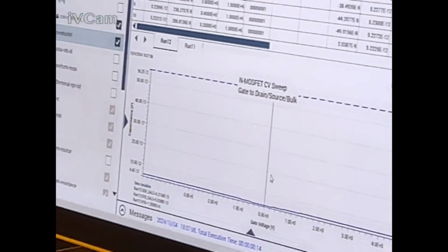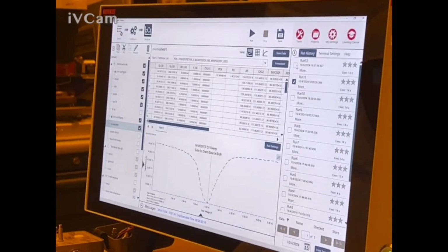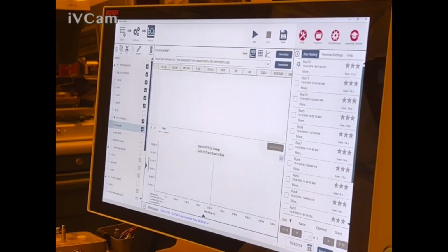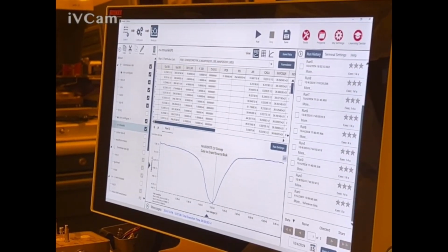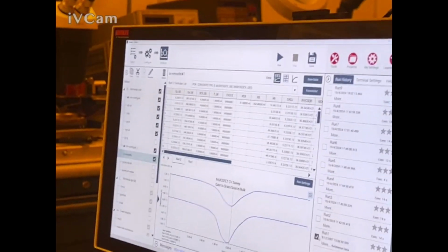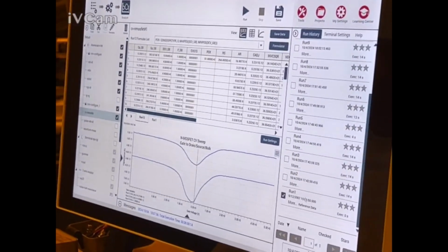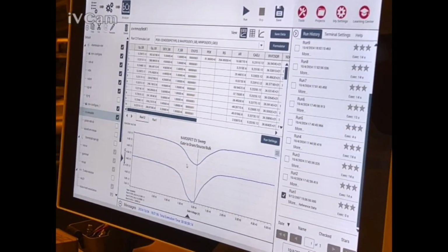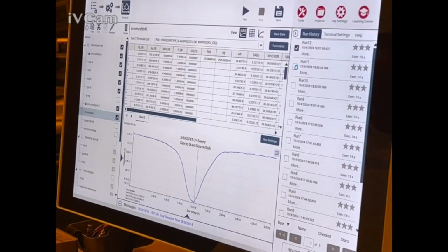Yeah, but wow, the scale is so weird, you're not seeing the whole picture here. That is like 55 without, and then with compensation. Okay, the original one has got more capacitance. It's about the same scale, but there's so much capacitance here that it's throwing off the graph. That's what it is. Wow, that's a big difference between that and that.